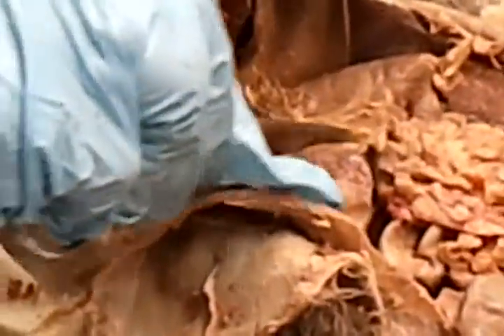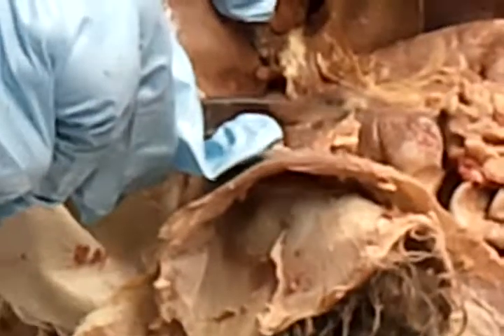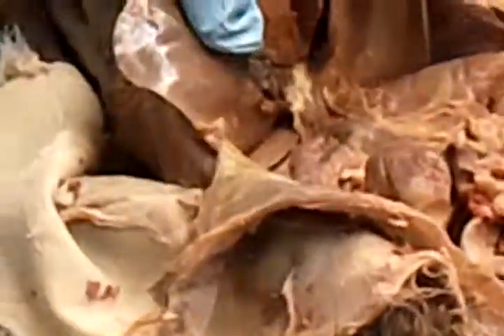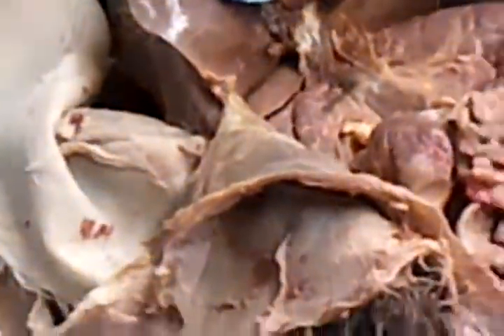So then under the liver, if I pull up the margin of the liver, and I'll swing this around, you're seeing what's called the body of the stomach. And this cat's stomach has quite a bit in it, so it's quite large. And then remember the pylorus feeds into all these loops of small intestine, which you really can't see because there's a structure in front. Let me just swing this around to show this side. If we pull up on the liver, we're looking at the stomach.